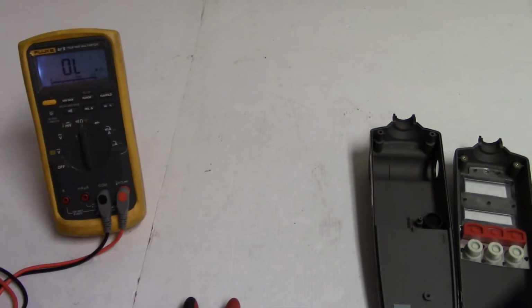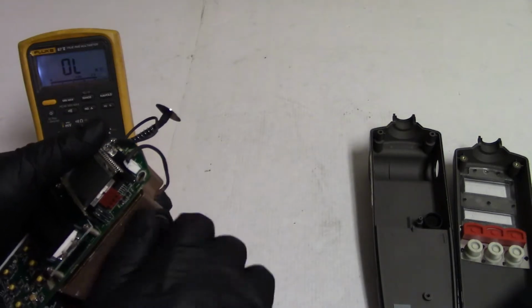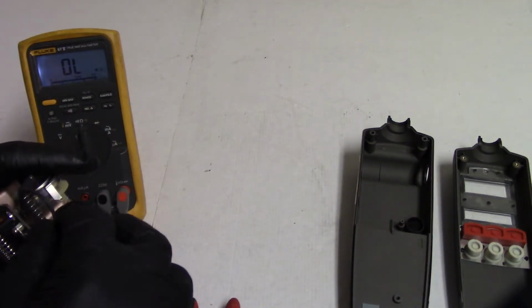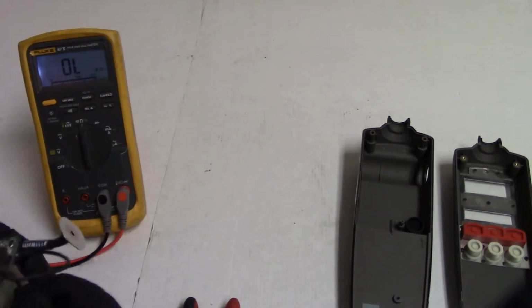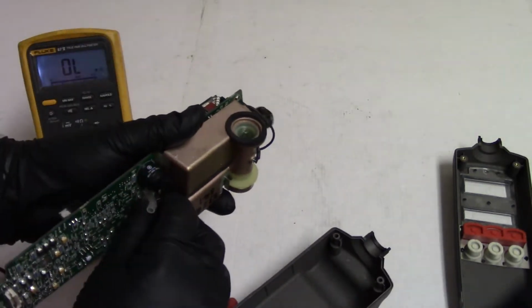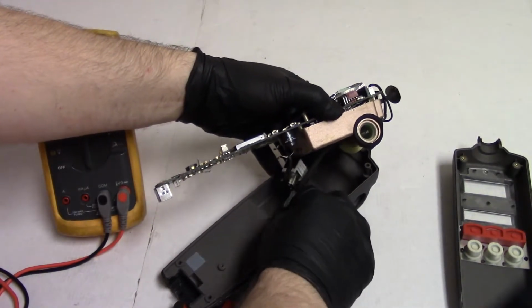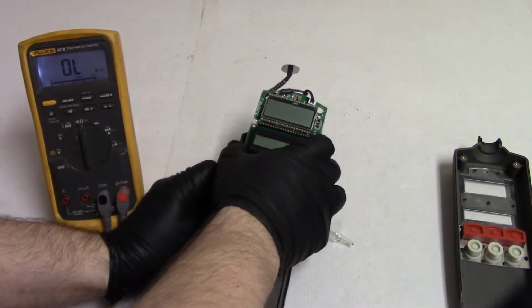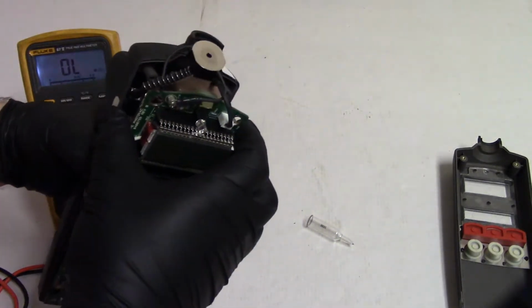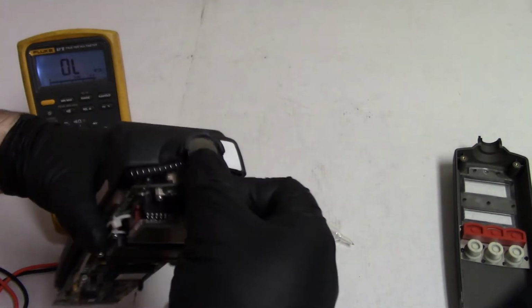So, anyway, let's put the tube back in. Let's put the cap back on. Actually, let's put the cap back on after I set it back in the bottom, because we're going to fire this thing up. I want to see this thing run. Let me just wrap that back around there to help manage that wire. And then we're going to put that, so plug that into here, and then we'll snap the pump back into its bracket, rotate it so it's in the right place, like that. Just set all this stuff in, run that tube where it needs to be. There we are.